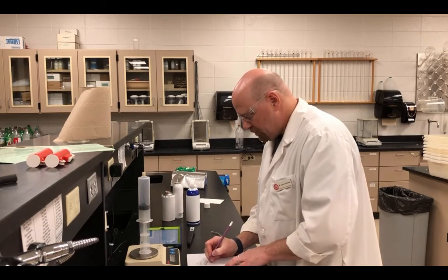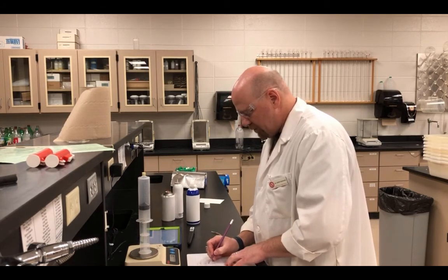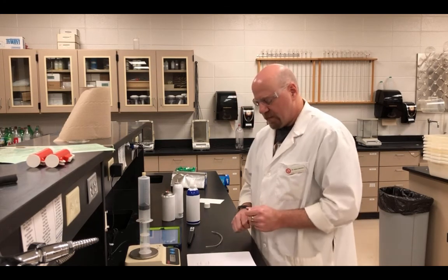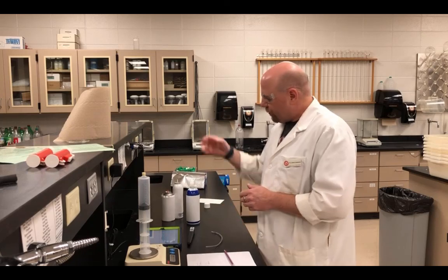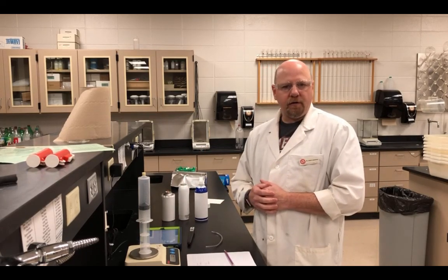Temperature's the same. And the pressure is the same. Basically, we do this another set of 2 for these 2 gases. I will share that data with you and you're ready to do your calculations.